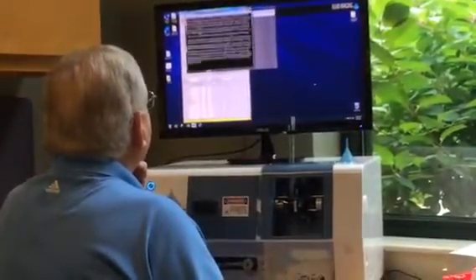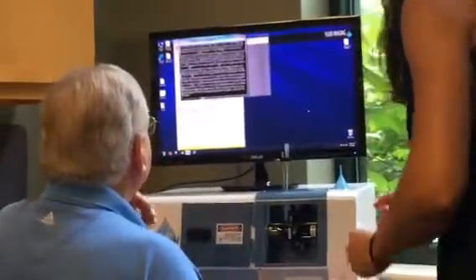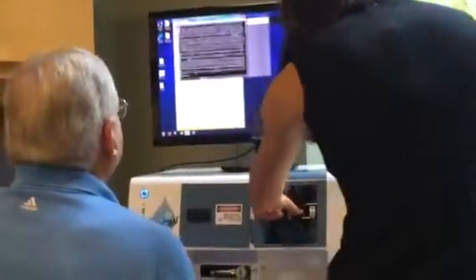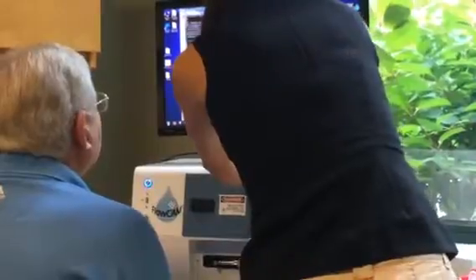Settling. Oh, looks like this was knocked out of focus. I think the janitor was in here yesterday, he might have moved the instrument. Yeah, alrighty. You just have to remember that. And you know, you don't have to stop the run to focus it, you can just do it mid-run. And look how much better off we are now, we're getting one particle per image, so we're getting much better data, much more reliable counting.